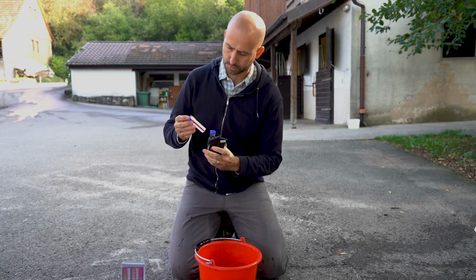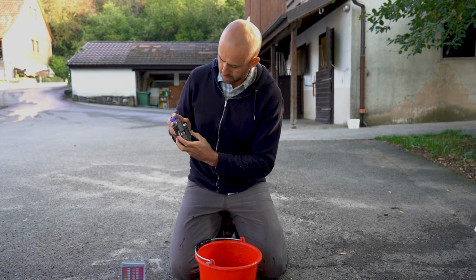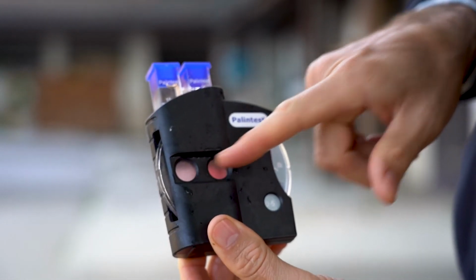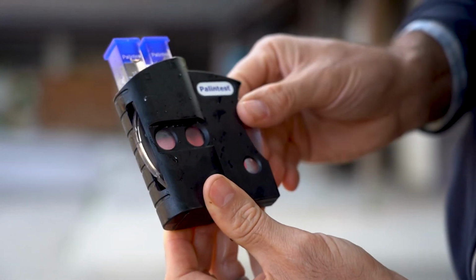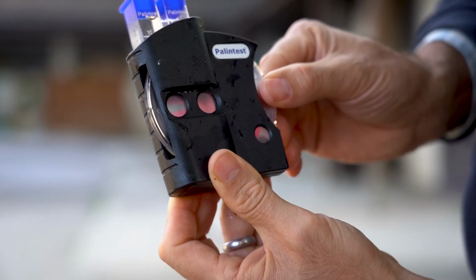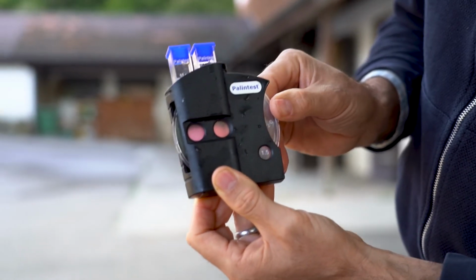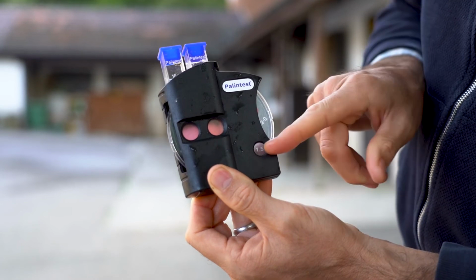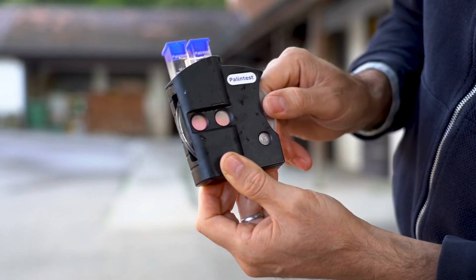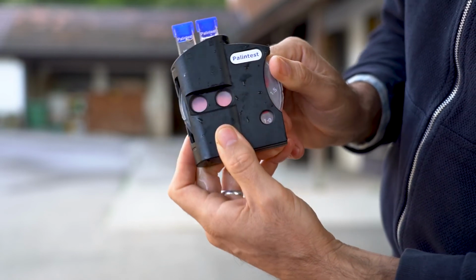You can see already it's changing color to red. And the darker the color, the higher the concentration. You can see that it's a bit darker than the 0.5 milligrams per liter. So if we go up to the 1.0, it's quite close to that, maybe possibly even somewhere in between the 1.0 and the 1.5. But the idea is you turn the wheel, match the color, and then read the number. So in this case, it's somewhere between 1.0 and 1.5 according to the color wheel.